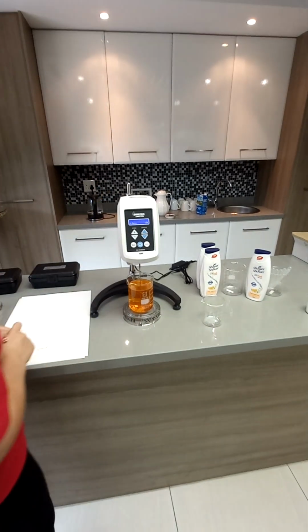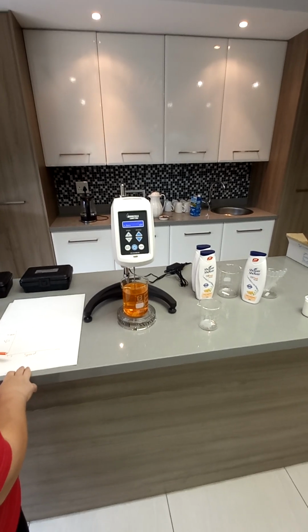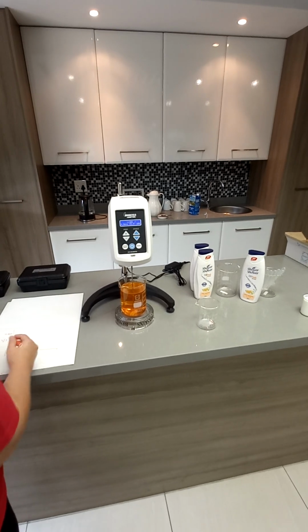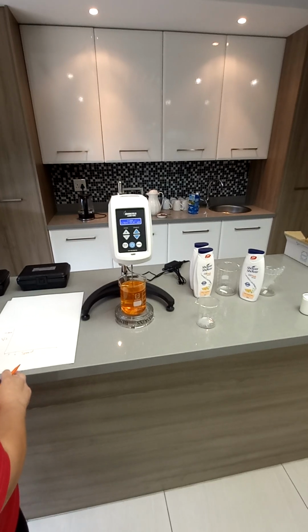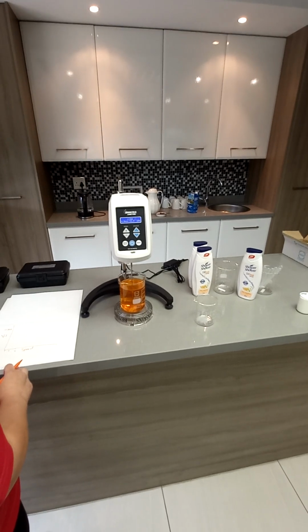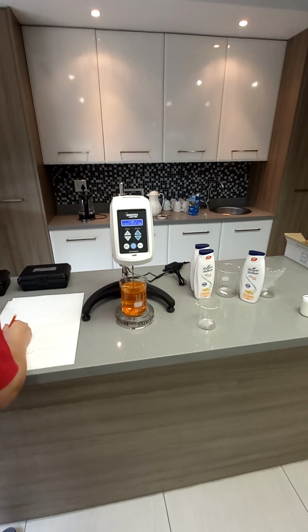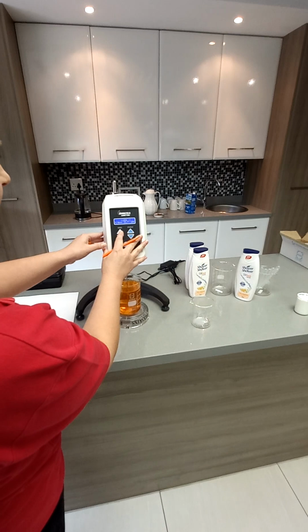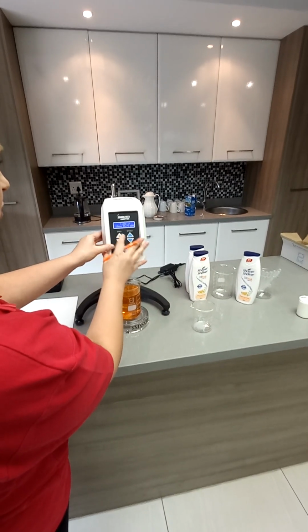Let's put it at 4. Let's see what happens. About the same. Let's change it to 10.